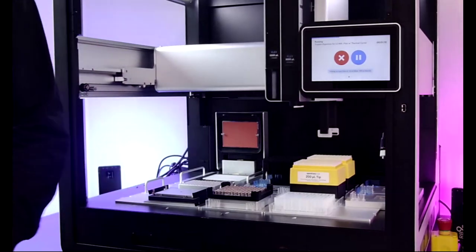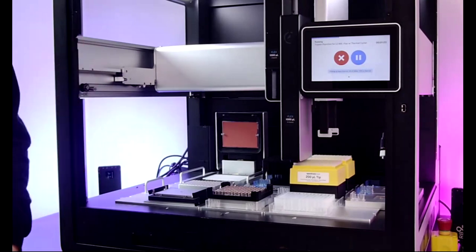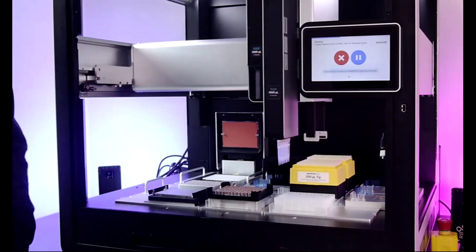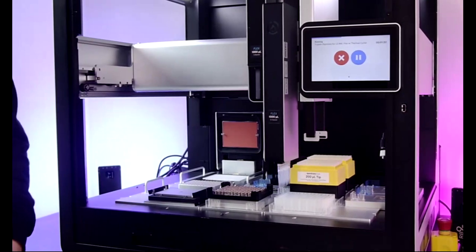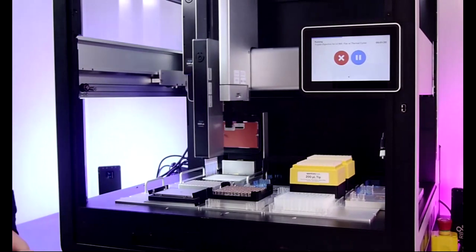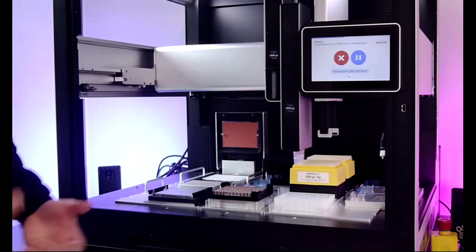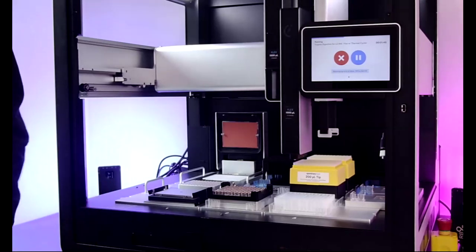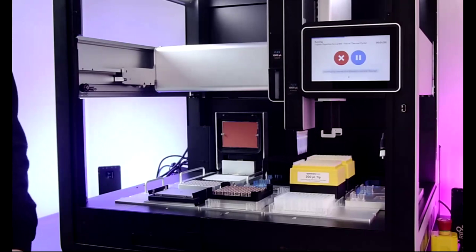As you saw in the tables, this protocol is designed for column-based work. For demo purposes, I just shortened it to only do one sample, but we are still going to use the 8-channel pipette here to take all of these reagents in order to do this quickly. So these will be deposited into the plate that's on the thermocycler. Because the plate is already on the thermocycler for this as well, which is a really nifty trick to save time and also save deck space, we will not need to have any kind of gripper interaction.